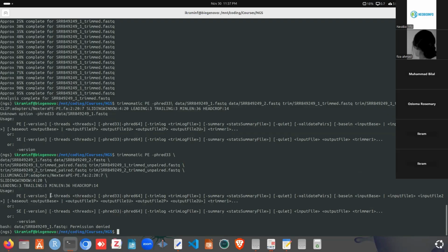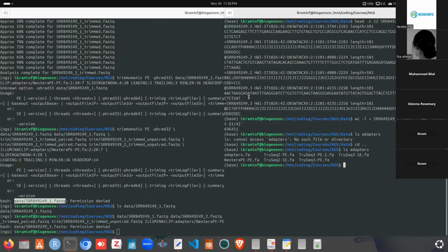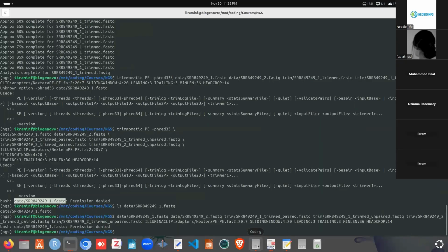Okay, we can see what is happening in here. You have opened the file. I think you can close the file. FASTQ1 first, when you read that, it will be fine. Permission is denied. The file is open. I think so, you can check in your system. The first R1 file, because the permission is denied. In your file after the build, yeah, here the file is open.